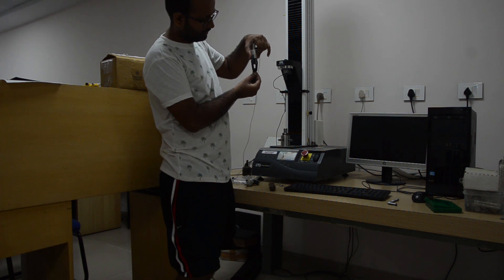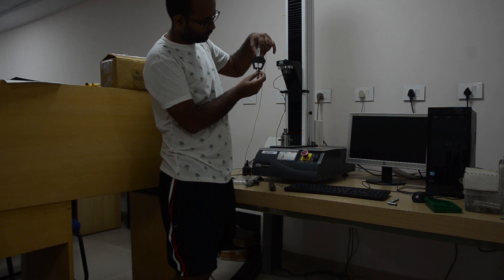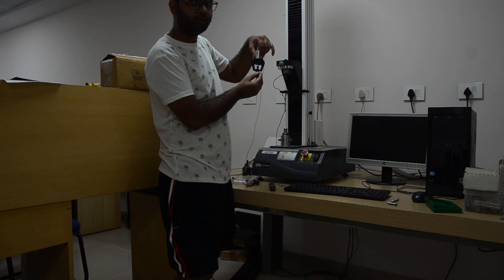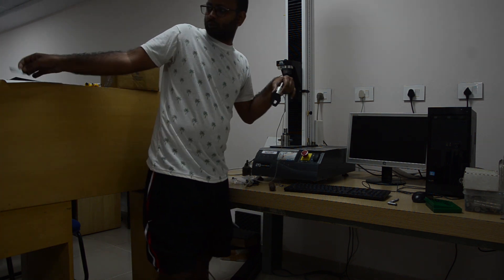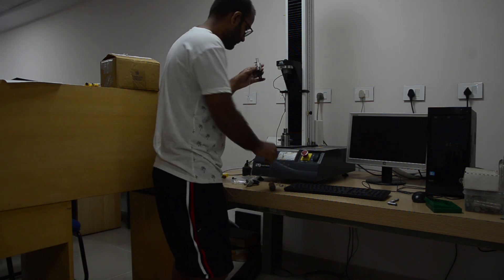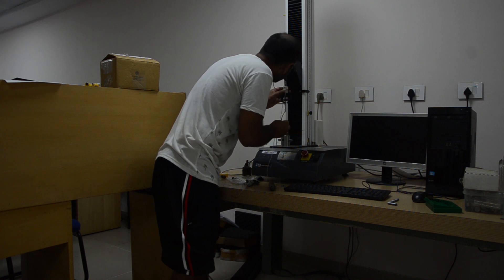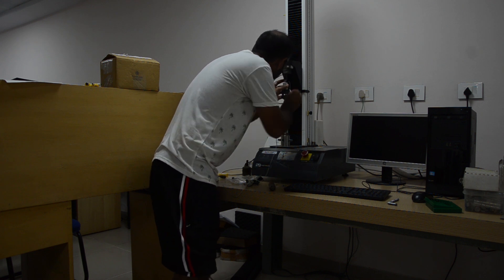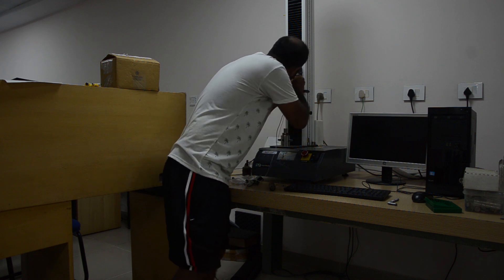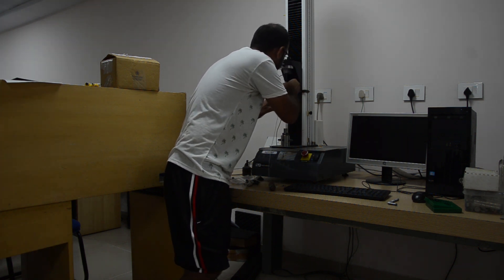The tab can maximally touch the grip here, but there is no need to touch it — you can leave some gap. The tab dimension should not be more than this. We simply hold it in whatever direction is suitable.